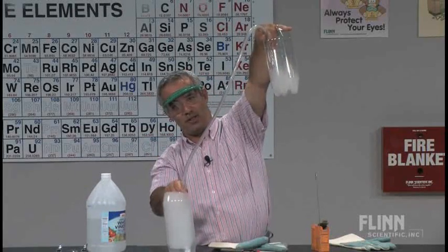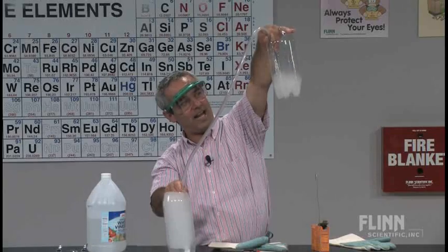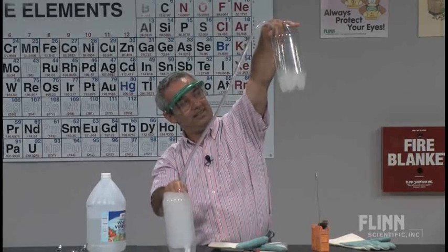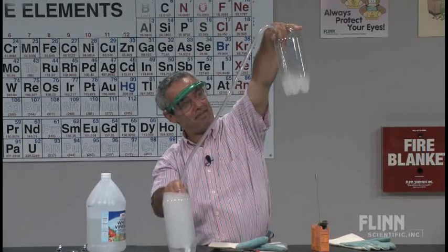I can go like this now. And don't have to prime it because the tube is filled with the CO2. I can go like this and it actually is siphoning back slowly.